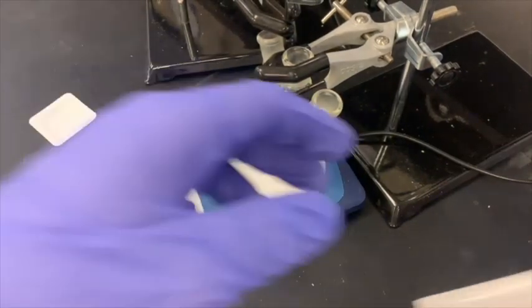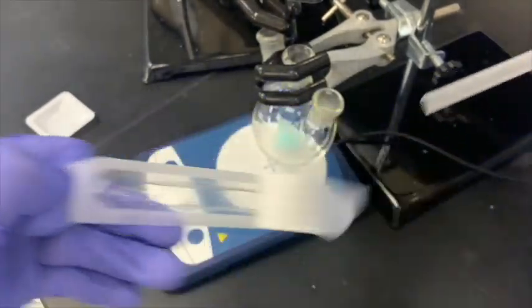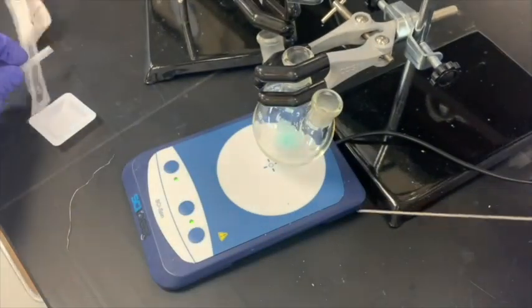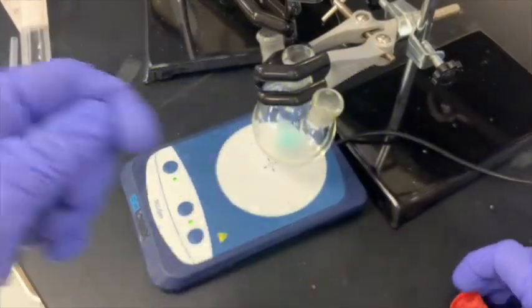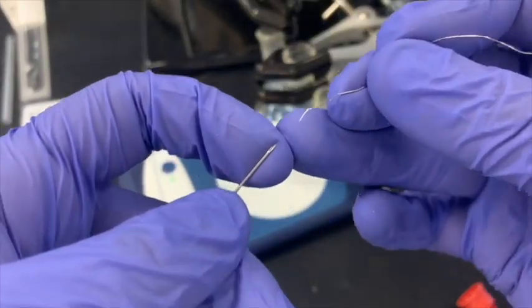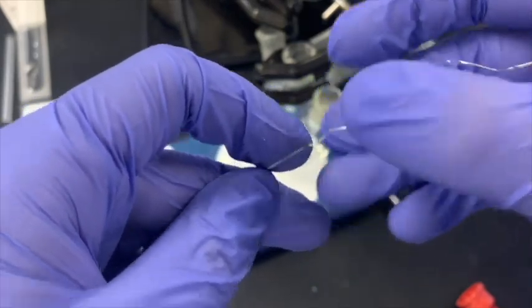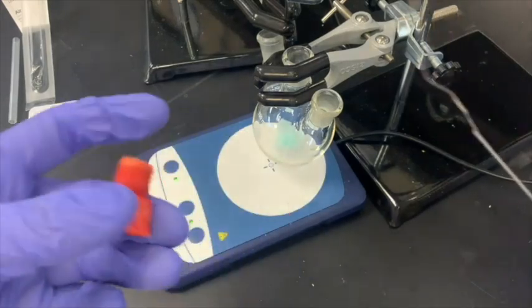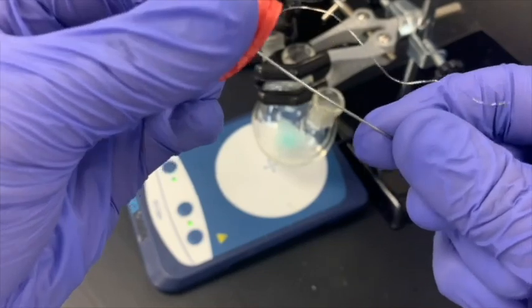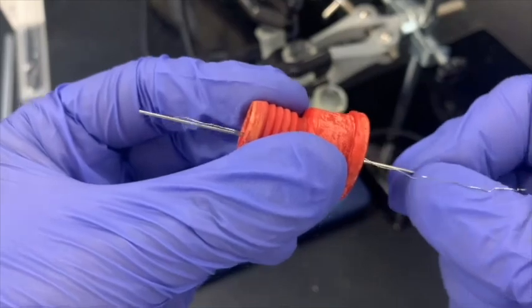Next, we will begin prepping our electrodes. We will start by preparing our platinum wire electrode. For this, we will need a clean hypodermic needle. Be very careful, because this is sharp. We will take the hypodermic needle and our platinum wire, which has been cleaned, and we will insert the platinum wire into the tip of the needle. Then, we will grab a septum and push the tip of the needle with the wire through the septum, feeding our wire through the rubber septum.